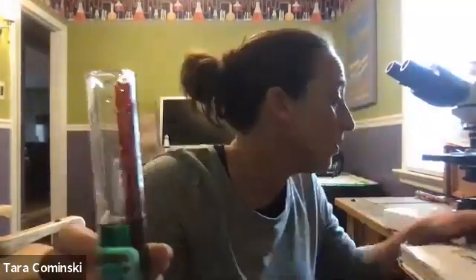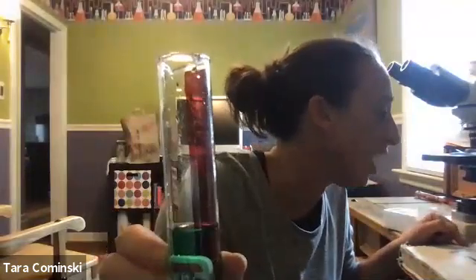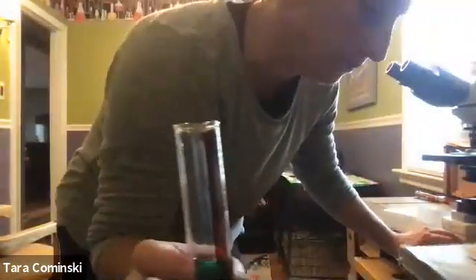So now you can answer that. It says the object, which is our eraser, right, has a volume of what? It started off at 20 milliliters. When I dropped that eraser in, the water level rose to 24 milliliters, okay? So what is the volume? And then you can kind of compare it back to what you did when you multiplied, right, if you want. All right, so that's for number 4 on page 13.